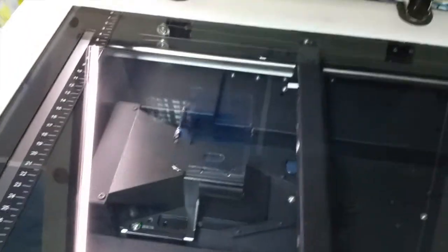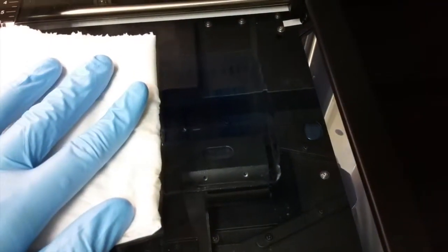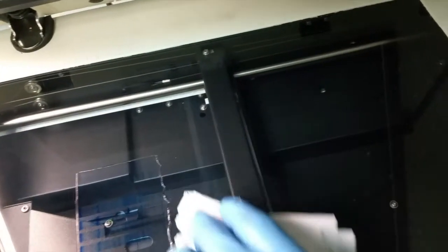I just put my gel on top. A little tip here: you can put a paper towel to absorb some of the water. What this does is it makes the gel stick onto the surface to create an absolutely flat surface. Just press on the sides and it will suck onto the glass — bubbles don't matter.